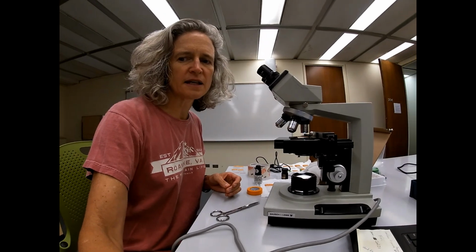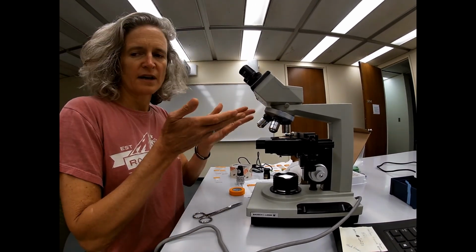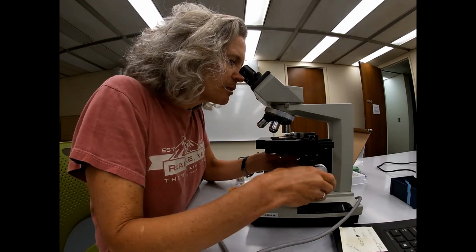Hello again. So this short video is a tutorial on how to use the camera in association with the microscope so that you can collect images of your stomata. All right, so I'm going to rotate this a little bit so we can see that computer. You remember how to use a microscope. So I actually have a prepared slide.